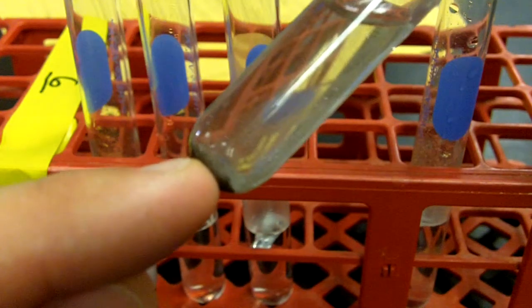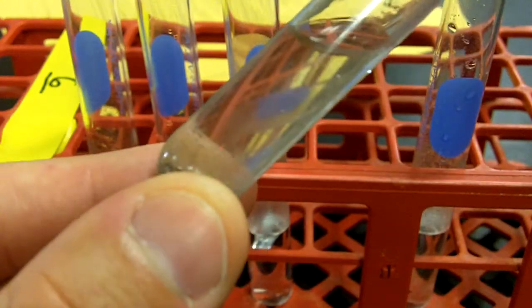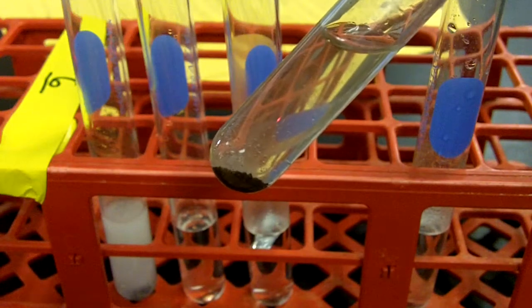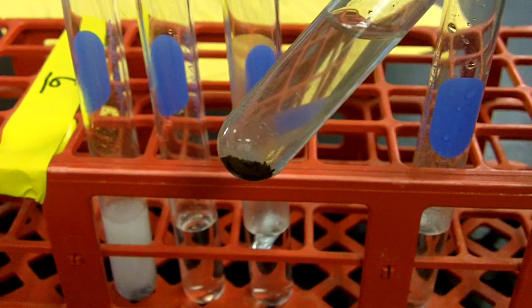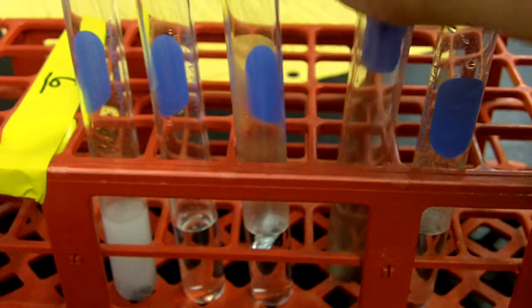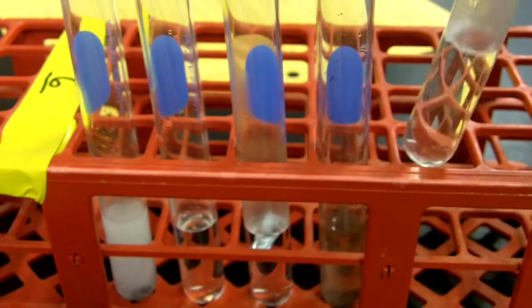And then small bubbles are creeping up as I rotate the test tube a little bit. Some of those bubbles are getting freed. Really difficult to see. You may see some based on the quality there, maybe not though. Slight bubbling, very, very little, but right, bubbles for Fe.